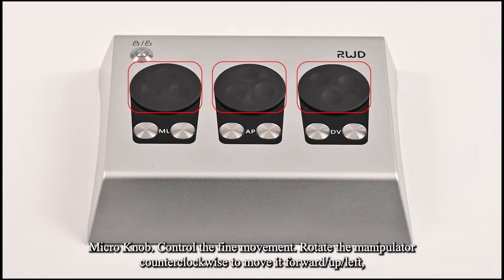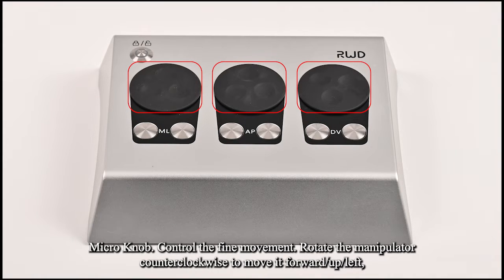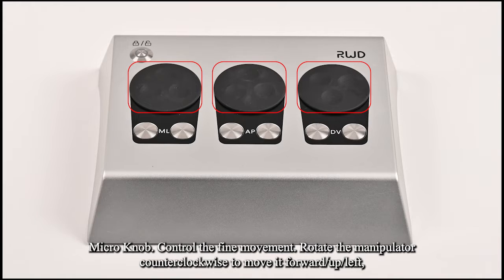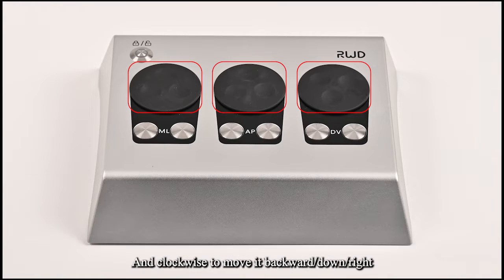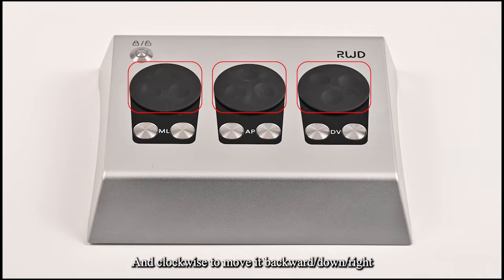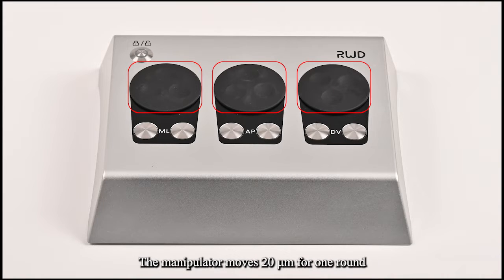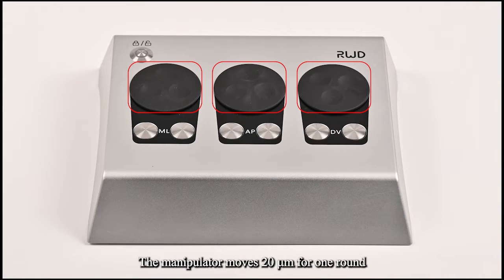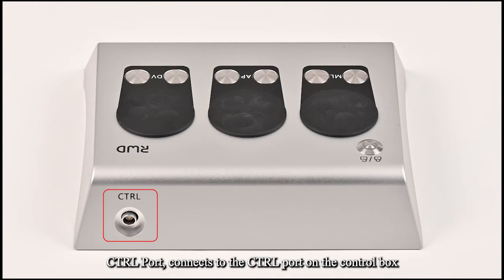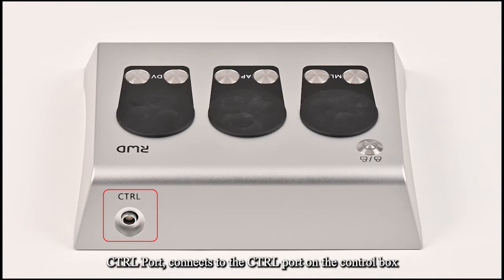The micro knob controls fine movement. Rotate the manipulator counterclockwise to move it forward, up, or left; clockwise to move it backward, down, or right. The manipulator moves 20 micrometers per one rotation. The control port connects to the control port on the control box.